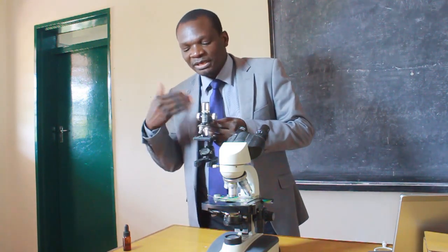You will find that the smaller microscope has only one eyepiece at the top, meaning you just need to use one eye to view through it and you will be able to see the image of the specimen clearly. The eyepiece lens is fitted on a tube — there's a tube on which the eyepiece is fitted. You can easily detach the lens from the tube. This tube is called the body tube.